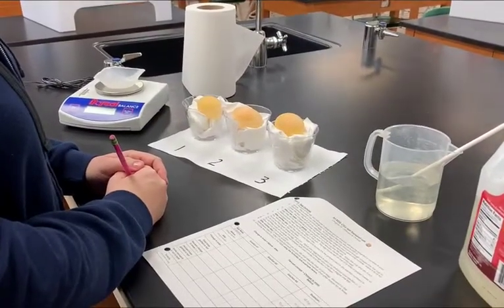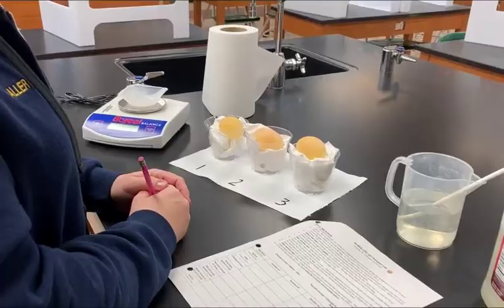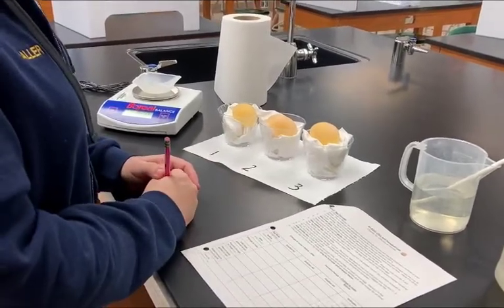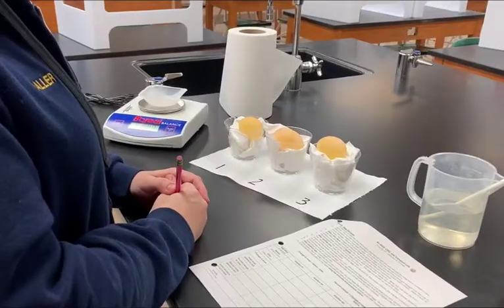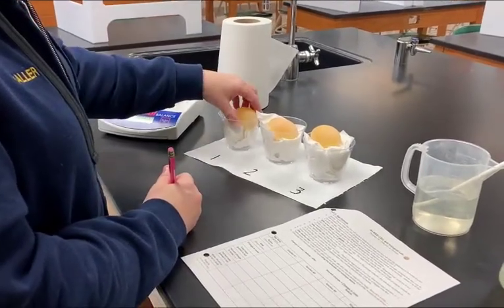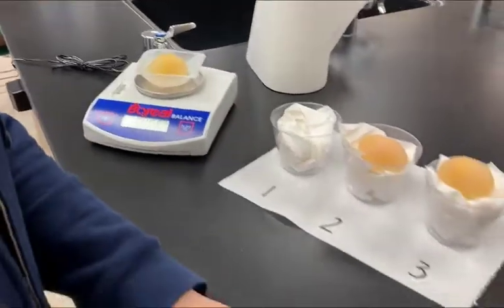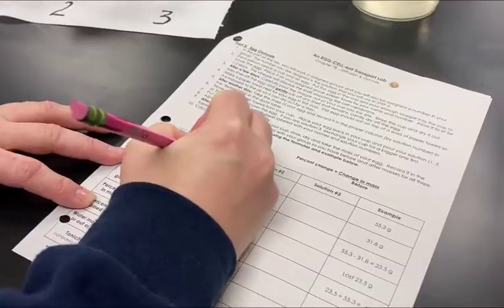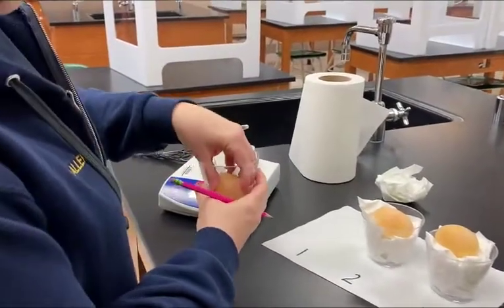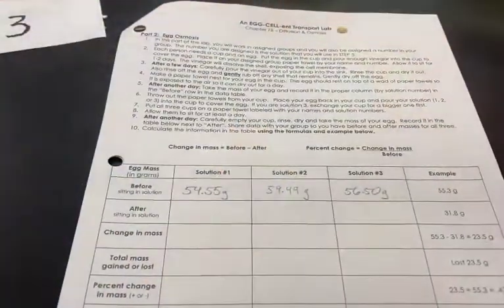We left the eggs overnight to air out and now we're ready to continue with the next part of the lab, which is procedure step number five. The first thing we're going to do is take the mass of each of the eggs. The reason we're doing this is because this lab is on osmosis, and in order to see whether or not water goes in or out of these cells we need to mass them. Ms. Haller is going to take the mass of every egg, gently put it into the weighing boat on the scale, and write that number into the data table in the before column. Here are the numbers that you should be writing down — their before mass.